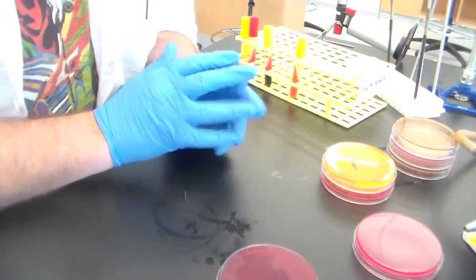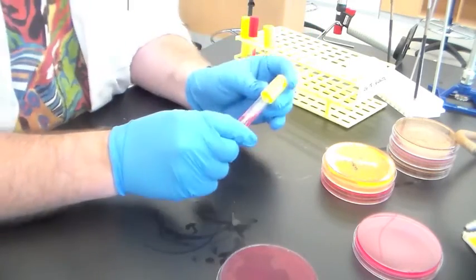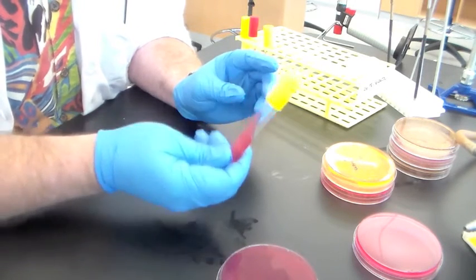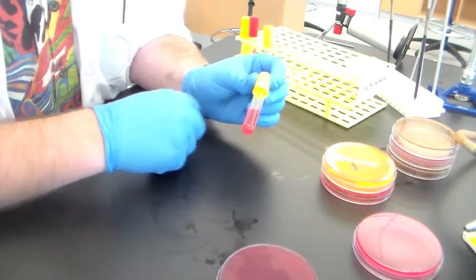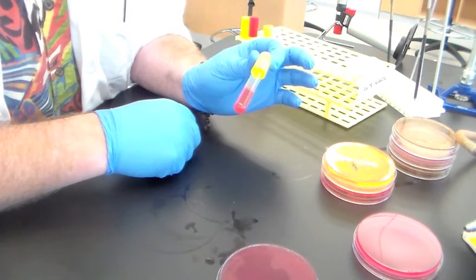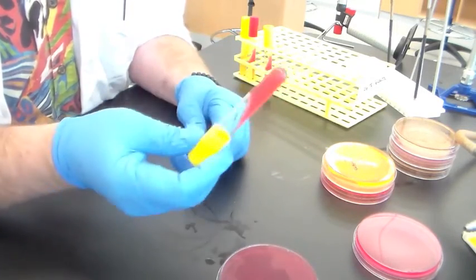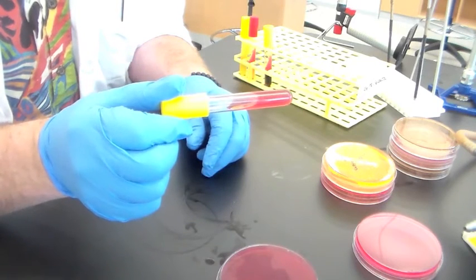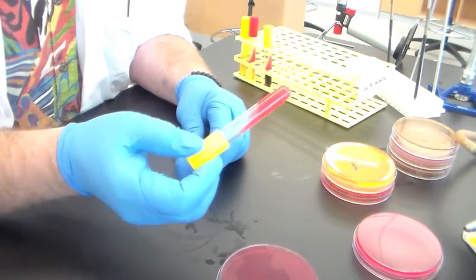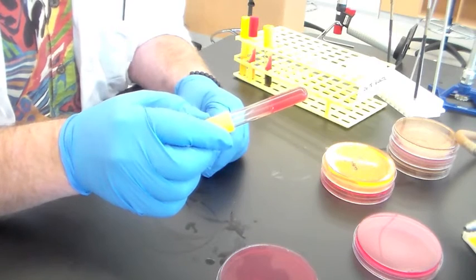Another media you inoculated last week is not a selective medium, but it is a differential medium. This is a medium you will not use immediately upon getting your unknowns. The triple sugar iron agar slants that you inoculated are agar slants you inoculate with single colonies of bacteria — ideally gram-negative bacteria. You can tell from the name that it has three sugars and iron in it.